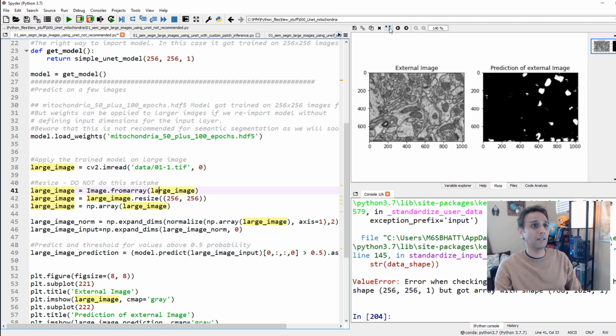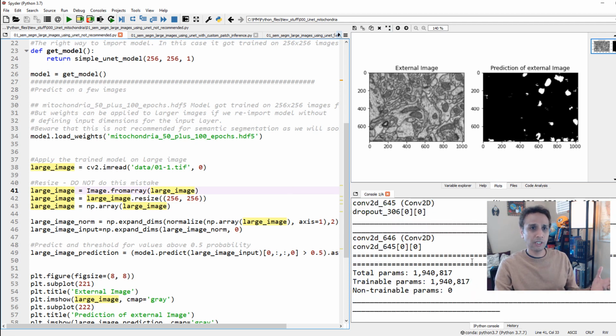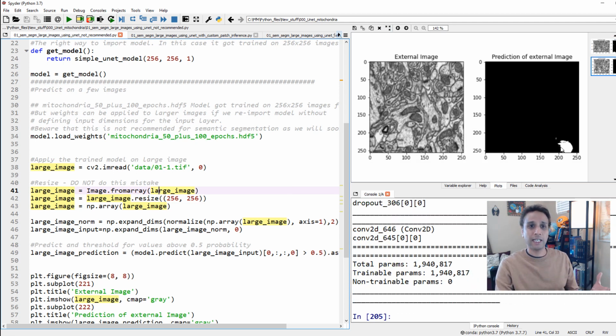Let's run this entire code one more time so you can see what happens. It should work. You should see some result, which is a crappy result. So now it actually resized my large image into a smaller image, 256 by 256, and tried to segment it. And you see the result is not good. So the lesson here is you learned two ways that you should not be handling your large images when it comes to semantic image segmentation, right? Even for instance segmentation.